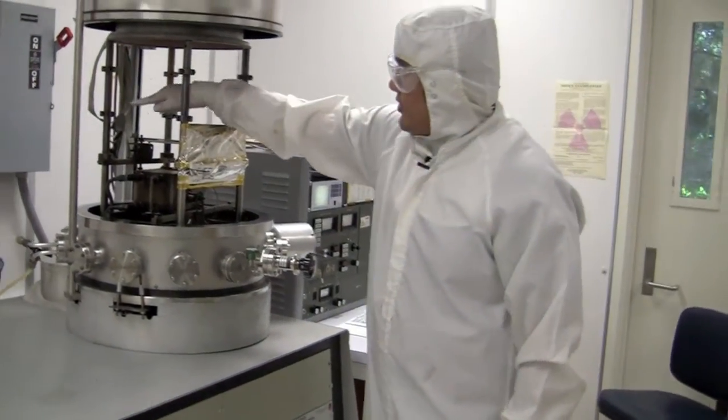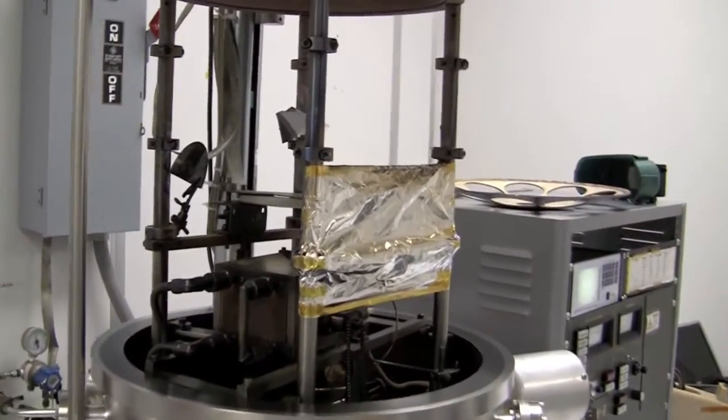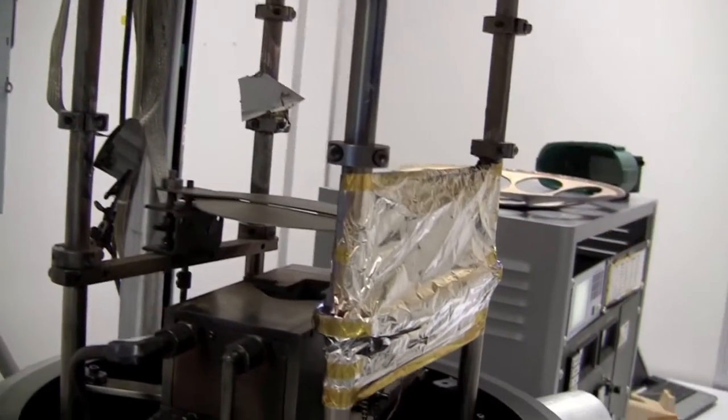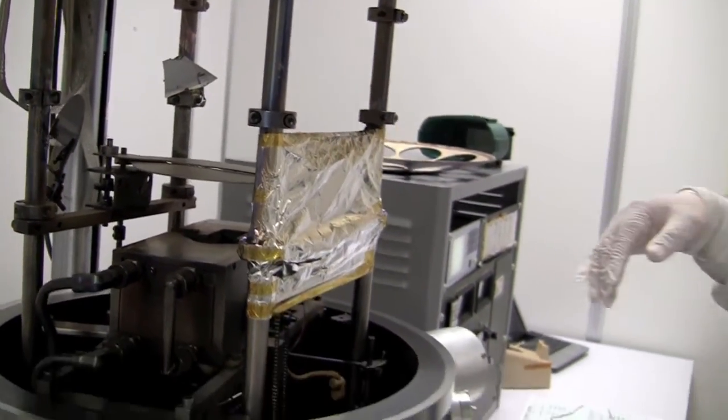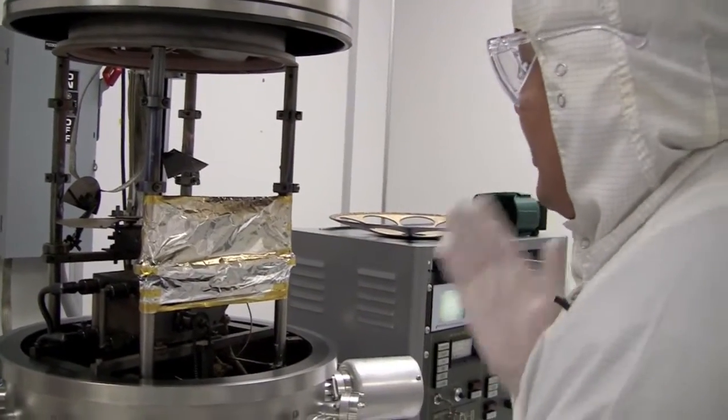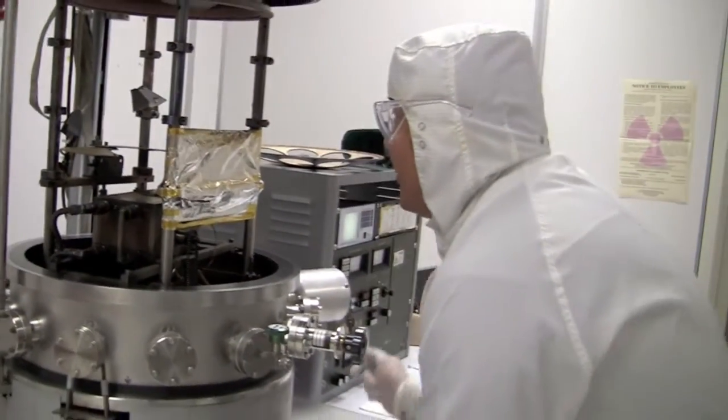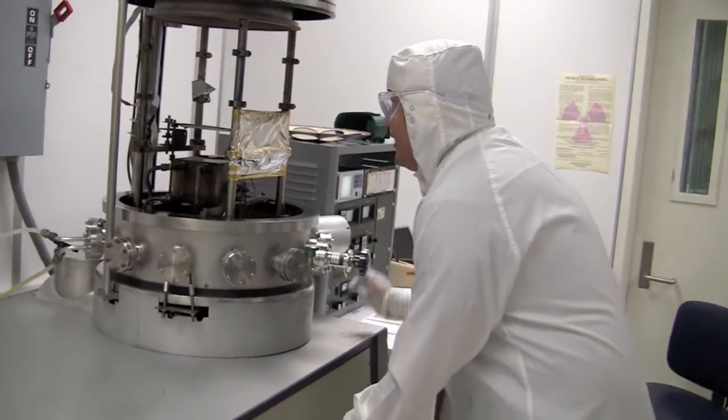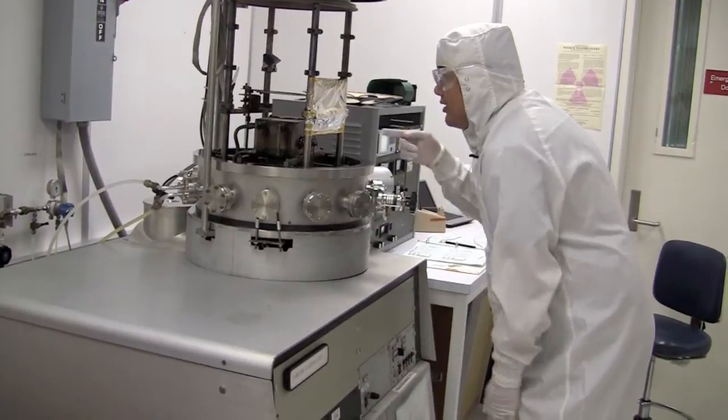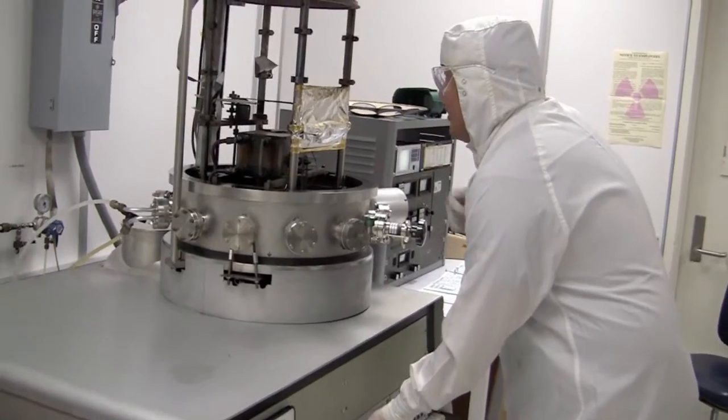It's also good to look at these two mirrors. So these mirrors help you look at your crucible when you're depositing. This mirror lets you see your crucible when the shutter is closed, and then this mirror lets you see the crucible when the shutter is open. So you put your head about this height to make sure you can see the mirror there when the shutter is open, and then the mirror there of your crucible when the shutter is closed.